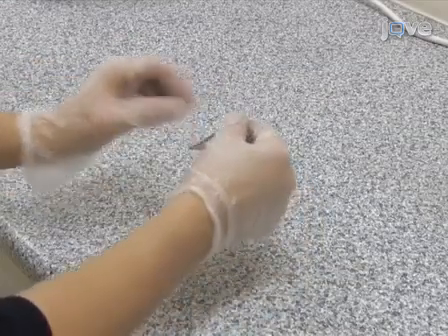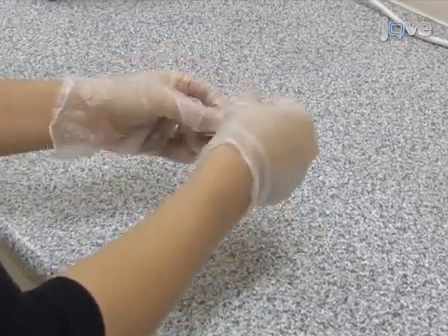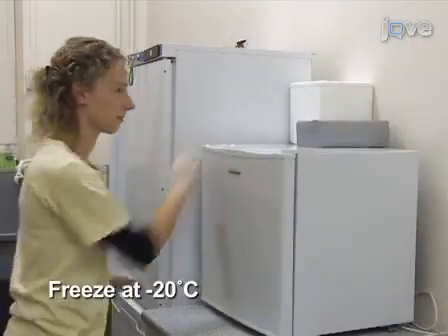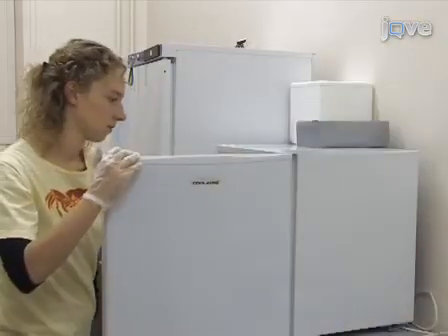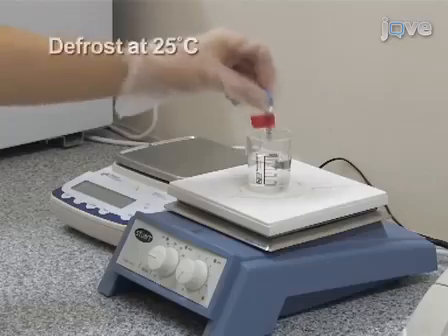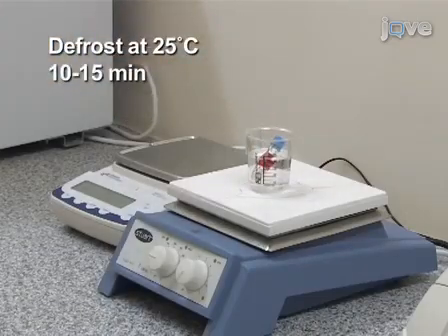Wrap the vial in aluminium foil to prevent exposure to light. Store the dye solution in a -20°C freezer. On the day of the experiment, defrost the dye solution by placing the wrapped vial in 25°C water for 10 to 15 minutes.